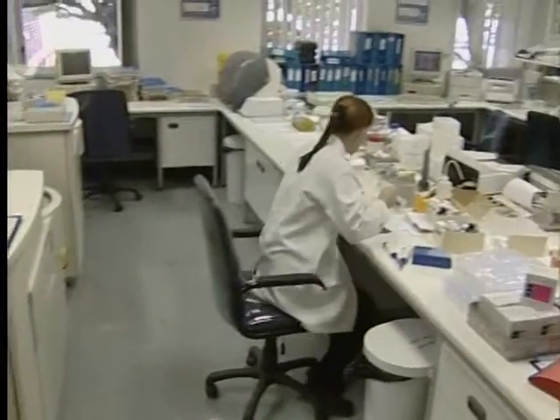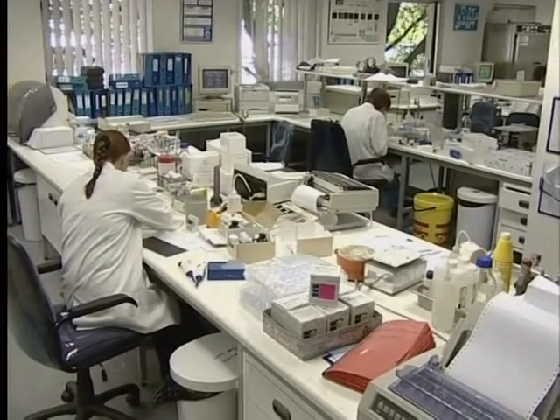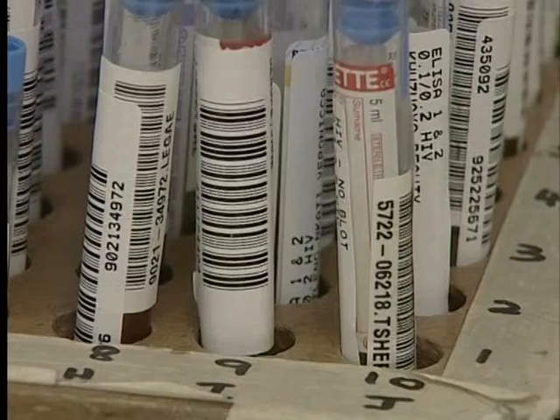These tests for the unknown ions are really quite amazing. And this type of chemistry we call analytical chemistry. Analytical chemistry has great importance in industry, medicine, and in forensic science. The procedures we have carried out show the basic principles behind the more sophisticated techniques used in a chemical laboratory. I hope you've been challenged to think and to find answers to problems through careful thought and controlled experiments.